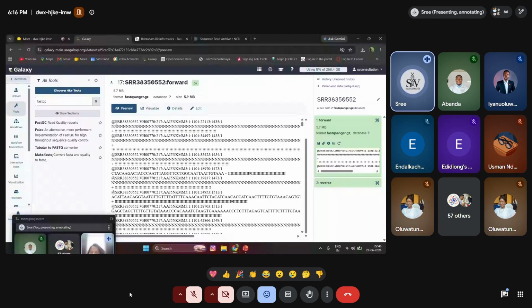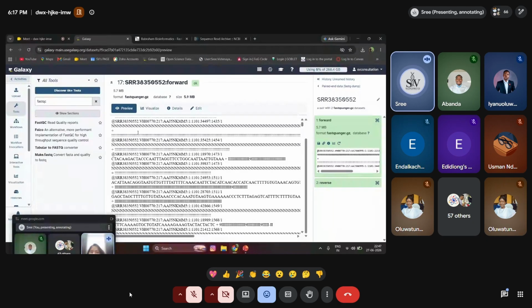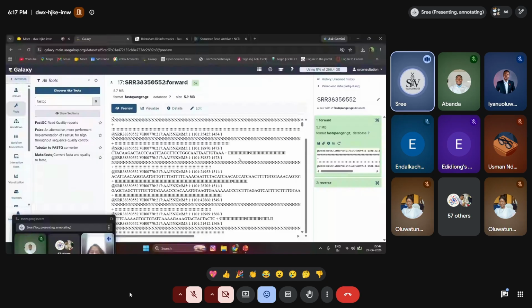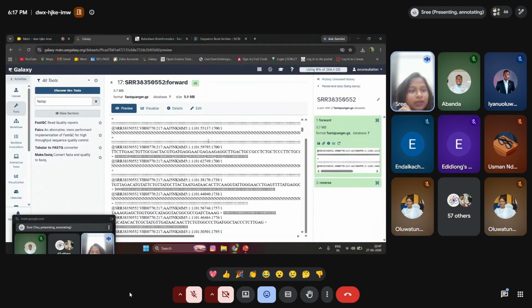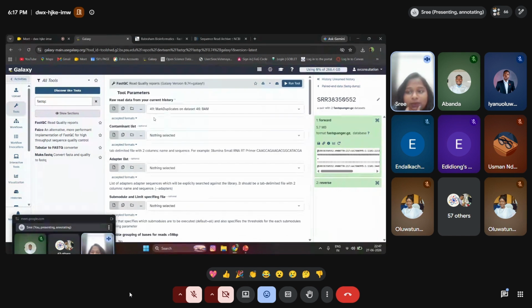It starts with an at symbol, followed by the SRR ID, then the read information, then the sequences. Then it has a plus symbol, and then what are actually ASCII characters, called Phred quality value information. All of that will be there. That's how the FASTQ file looks. So we need to do the quality check on the particular sample.